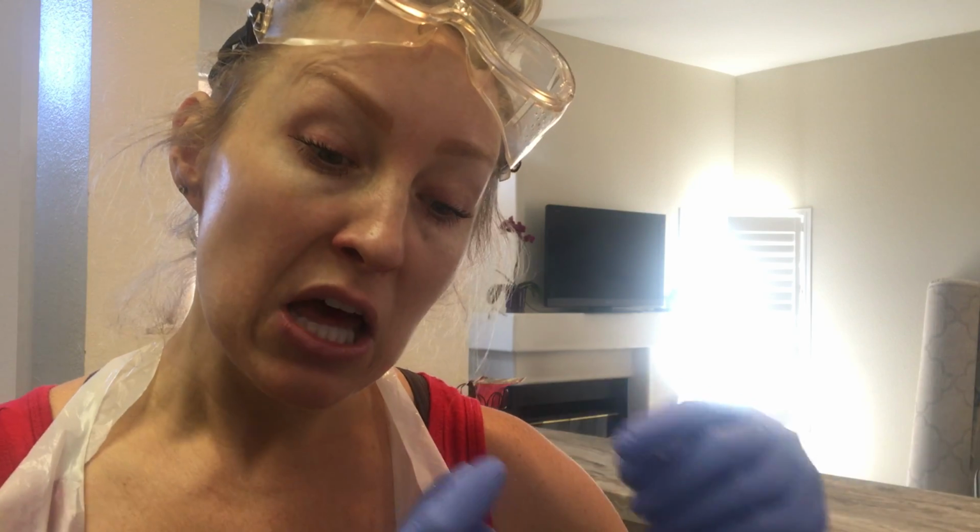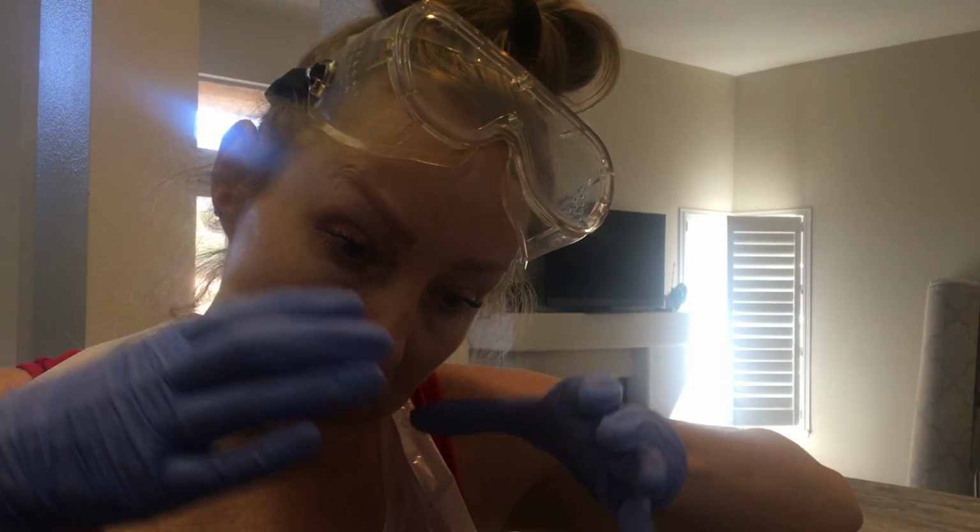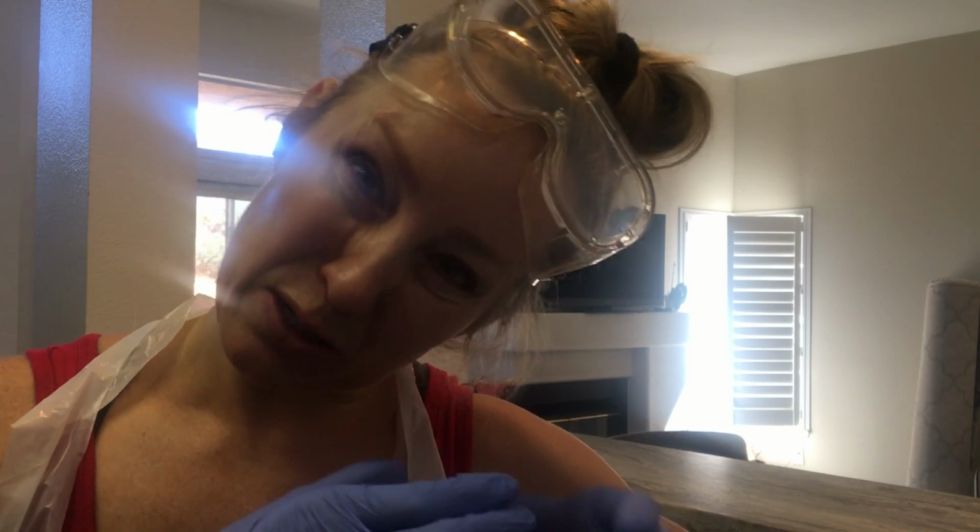To make it a little simpler, let's say the oil immersion lens, which is 100 times, and the eyepiece is 15 times: the higher the total magnification, the smaller the field. So imagine just something very close up. You have a smaller field of view because you're so close up on that. So that's what the field of view is.